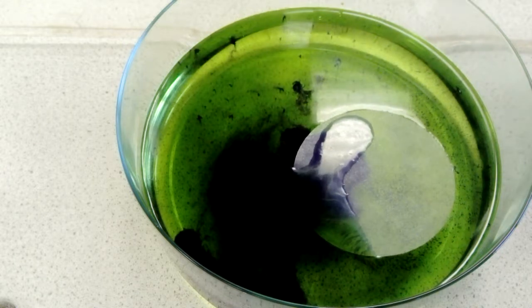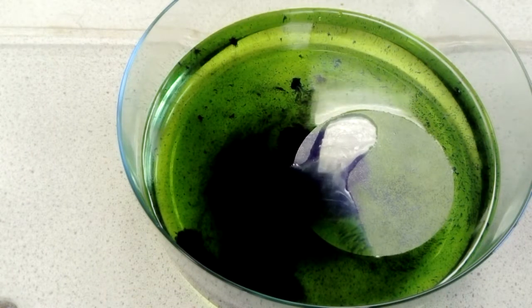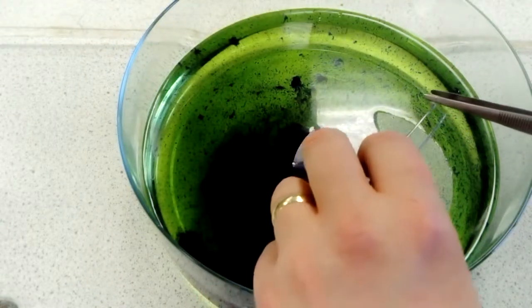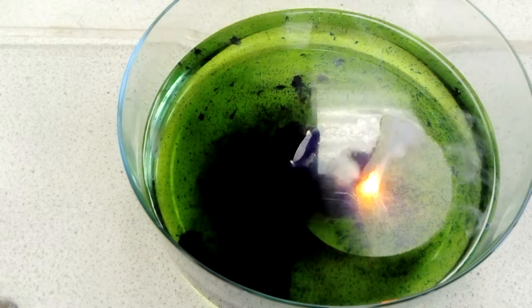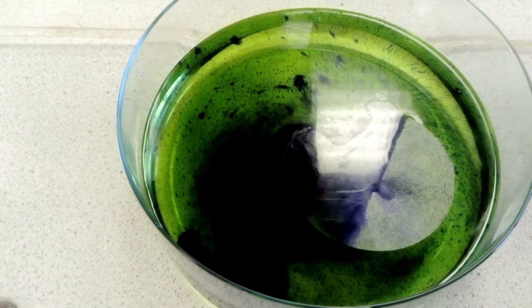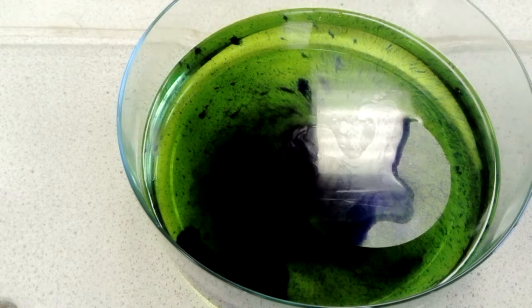Just because I've got a little bit more, I'll do that again. Is it going to do anything? Oh, there it goes. Why doesn't it last very long? Because there's not very much of it. We're not going to do any more of that.